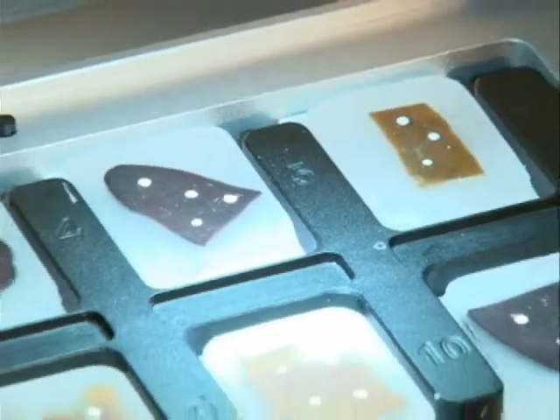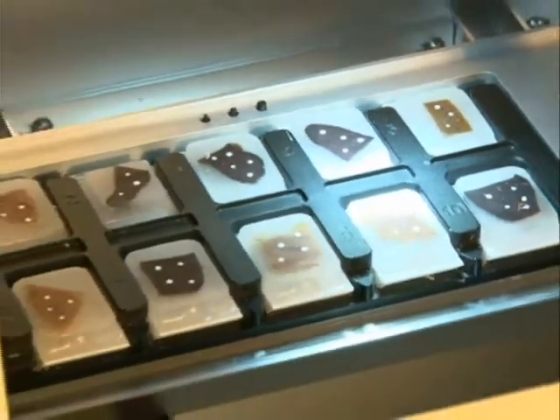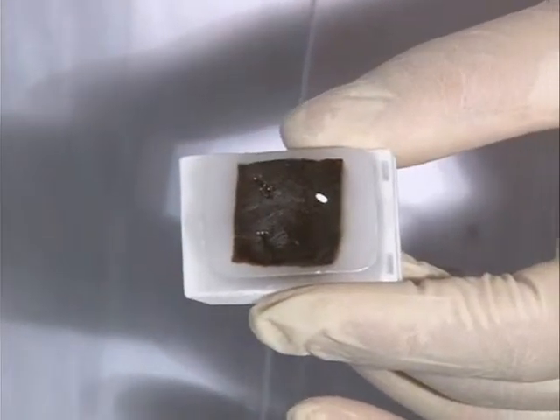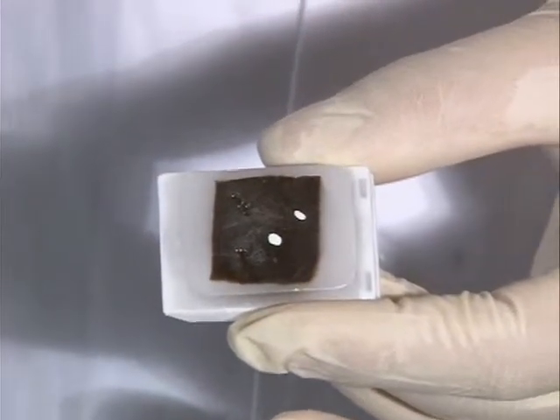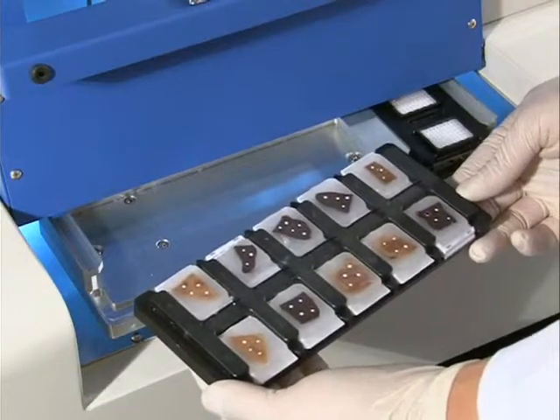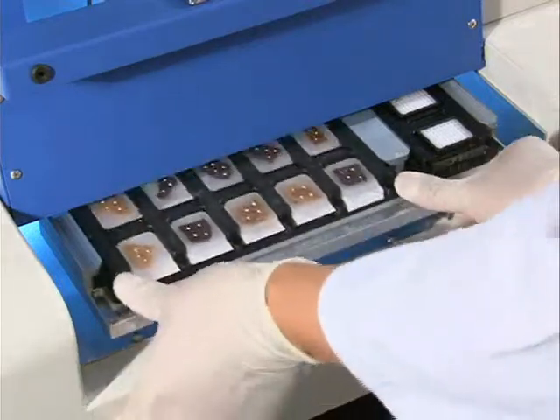The cassette in which a tissue sample is molded with paraffin and standardized is called a donor block. The user marks an area to be extracted in the donor block with an oil pen and dries the ink for at least 2 hours to mount it into the donor block tray. The donor block tray can accept up to 10 donor blocks, and it is mounted into the main plate.